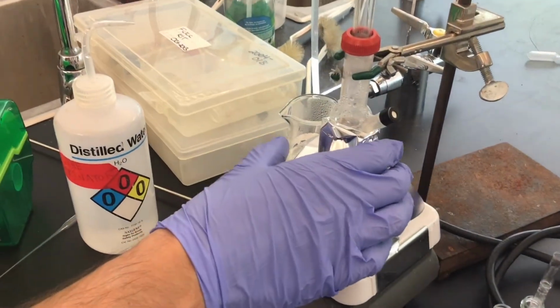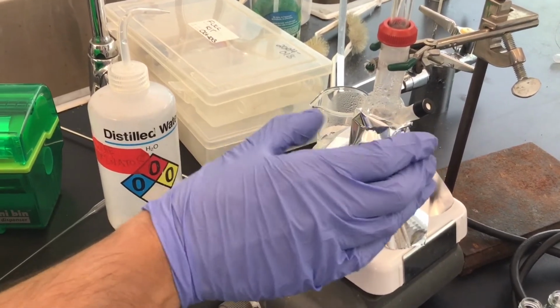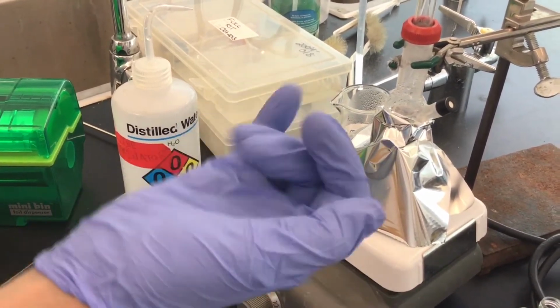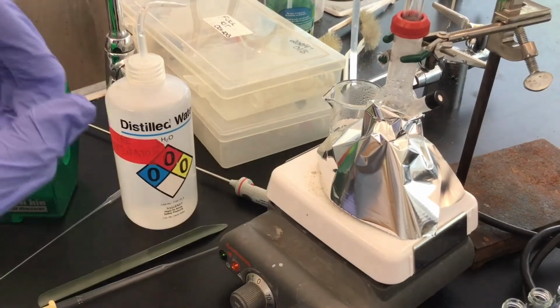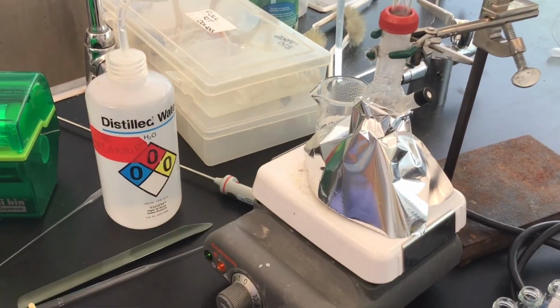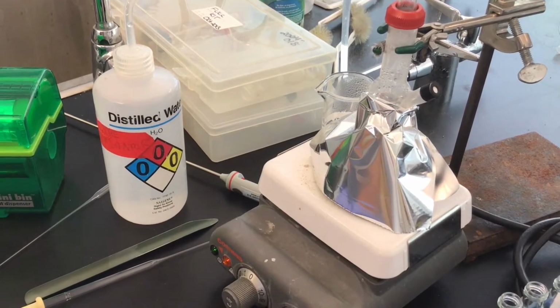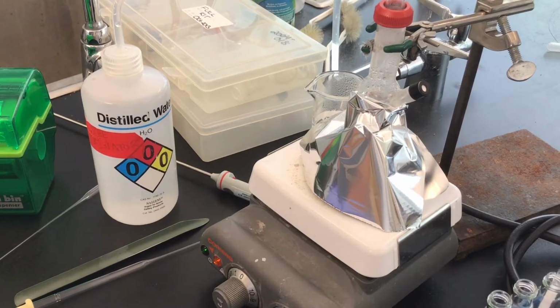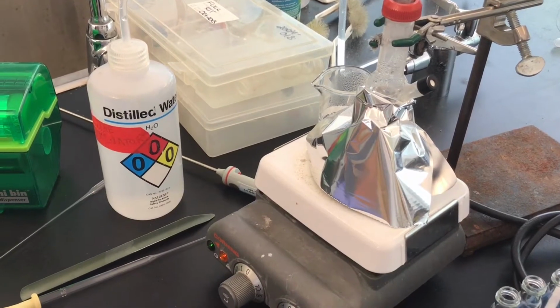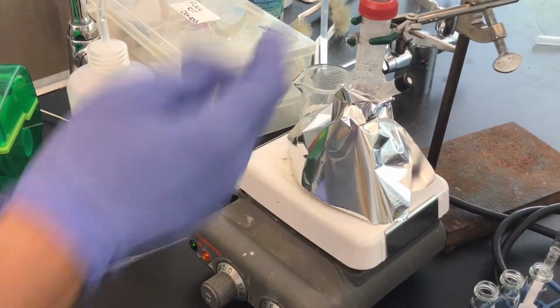And it's loosely held here, and what it's doing is maintaining a pocket of air in there, and preventing the very cold laboratory air, it's cold in here, from hitting the neck of the still head and just condensing back down into the distillation pot. So it itself, without the tent, is almost acting like an air condenser.